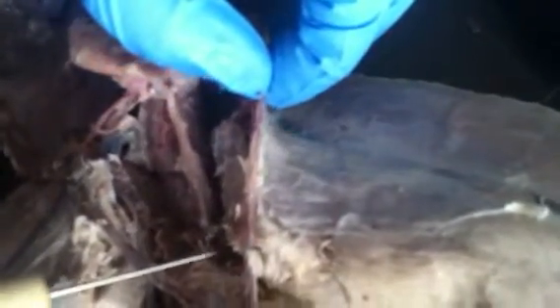These are the spermatic cords, which run down into the testes. This is the penis and the glans penis at the end, which is kind of covered, but it's hard to get all the skin off of it. It runs down on top of the scrotum. This is the scrotum, which I cut and left.